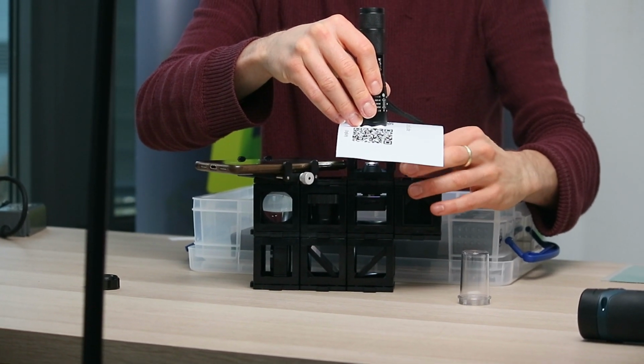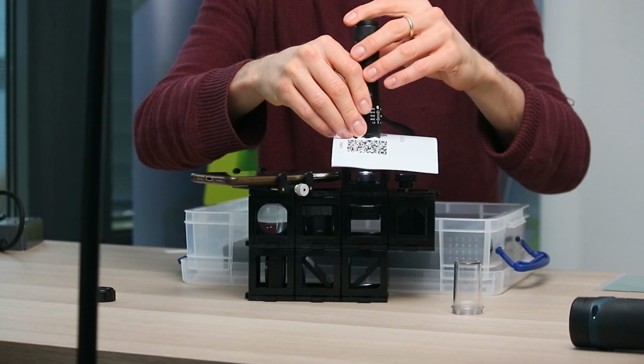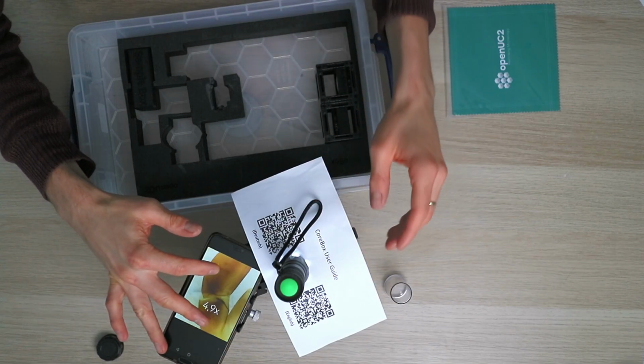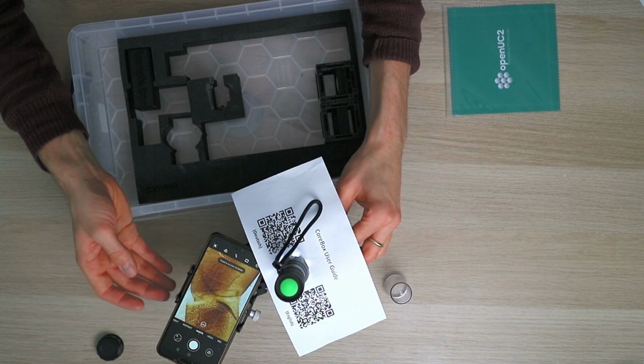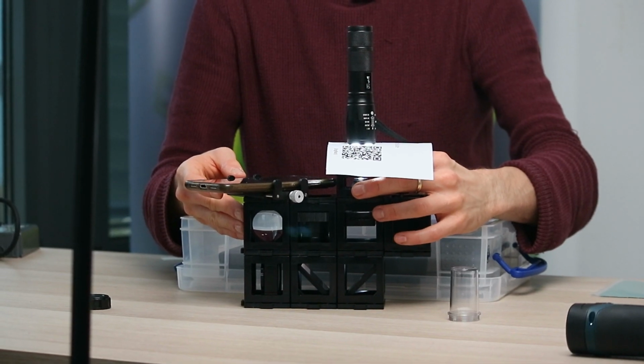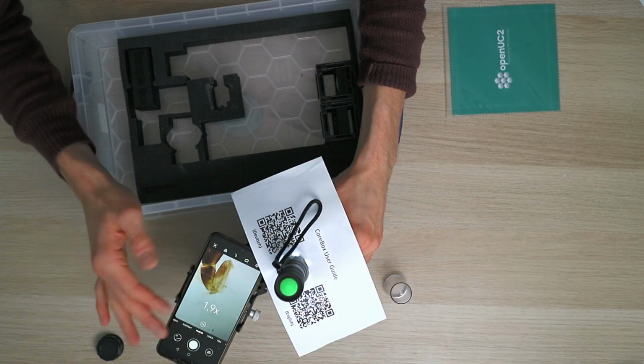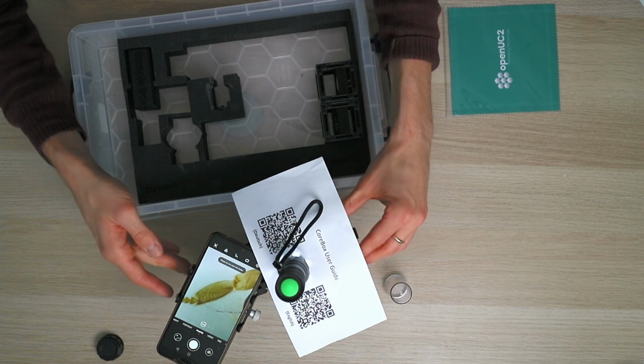So the Z stage is for fine focusing, and then we see the ant leg right in focus. So you see the hair of the ant. And you can move the sample around, and then you can see what's going on there. You can zoom in and out. And that's how a microscope works.